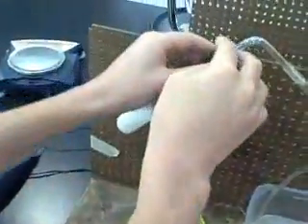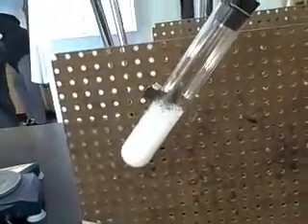Okay, and right now, as you can see, he did a pretty good job. And now, as you can see, it's foaming up into white bubbles. And the water level is decreasing rapidly, and it's collecting gas into the test tube.